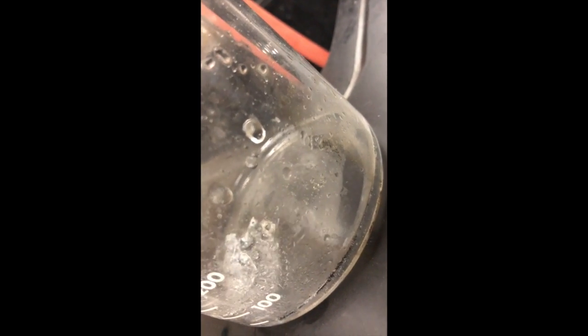This group did not follow the right directions, but it says that you're supposed to take a piece of zinc, a test tube, and a dropper and see what happens. If you look at this, we have steam coming off. We have the zinc surrounded by bubbly stuff. Is that a chemical or physical change?